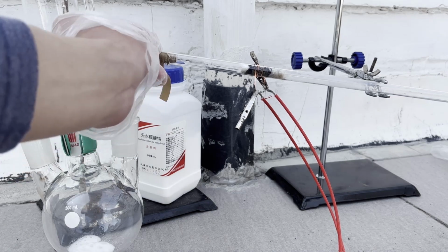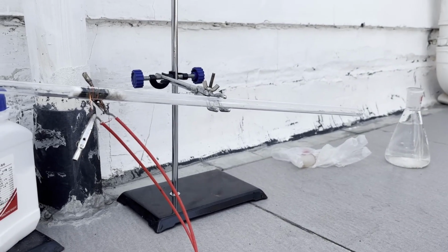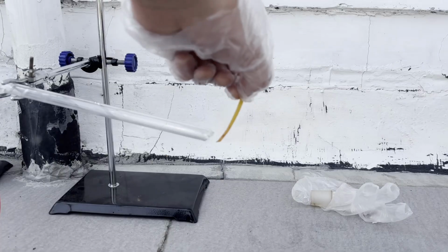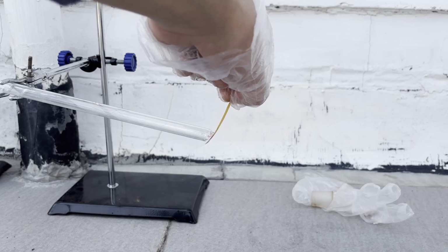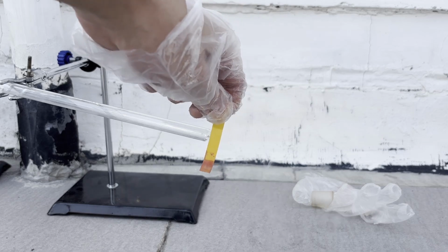In my personal opinion, the fumes this time were much more apparent than the test run, but still not as strong as the sulfur trioxide fumes seen in many other videos. But they probably have more concentrated sulfur trioxide than me, and as far as I know, nothing can fume like this except sulfur trioxide. So I'm pretty sure that the setup worked, and I made some sulfur trioxide. However, the main skepticism I held was whether this sulfur trioxide can be collected.